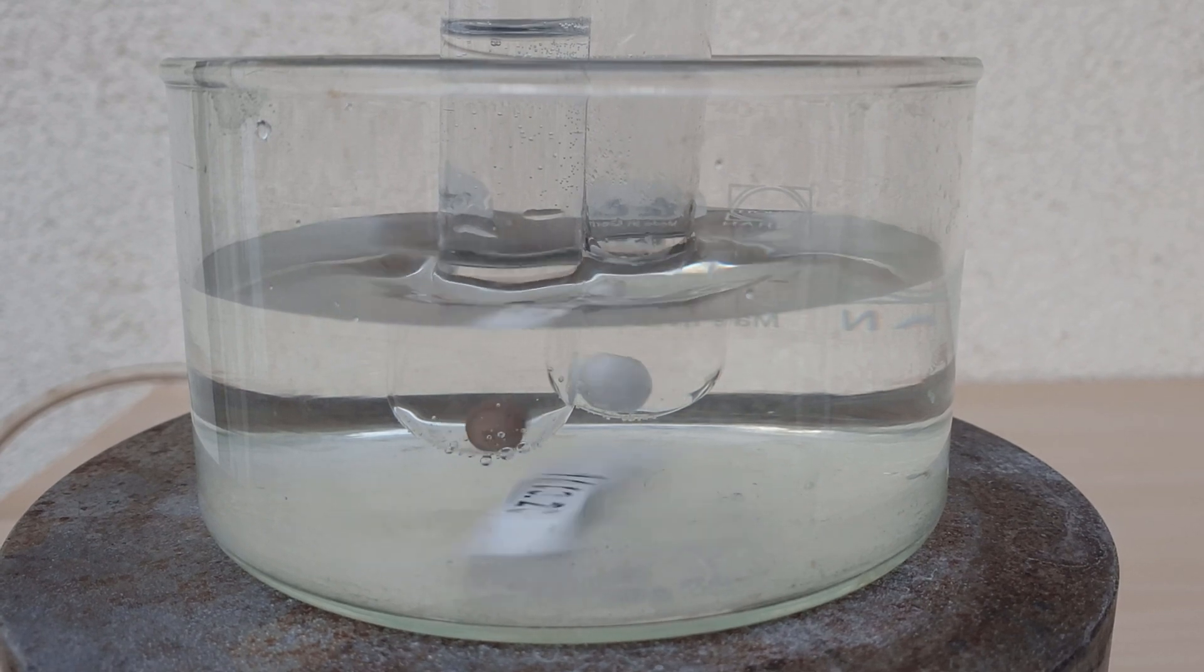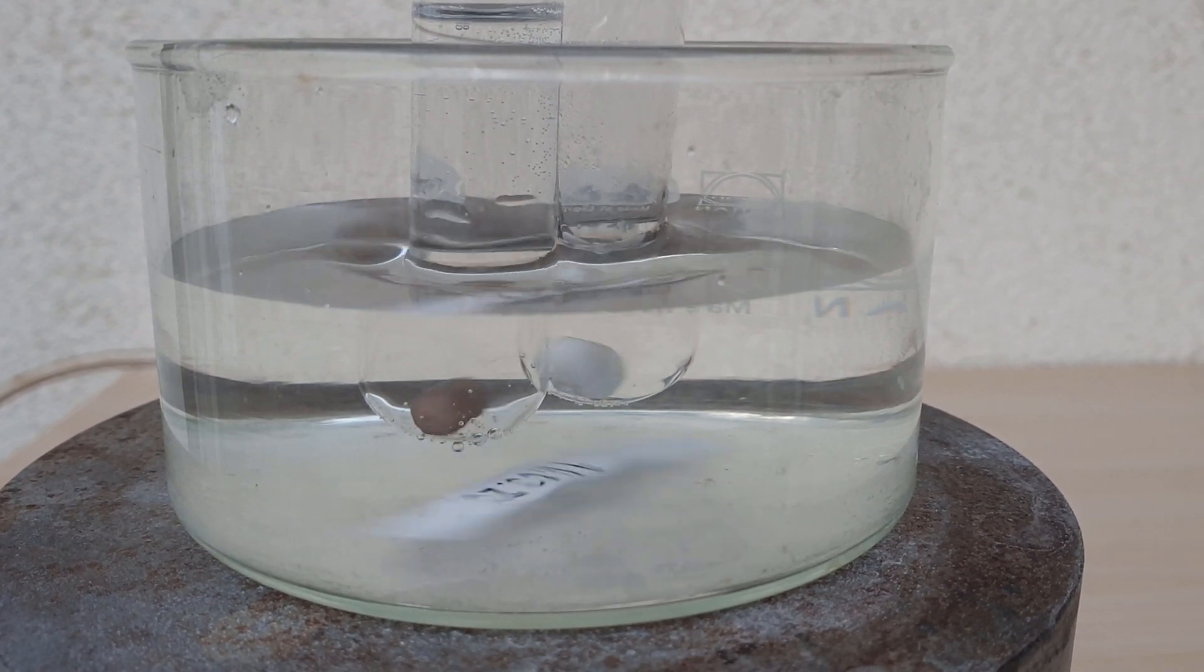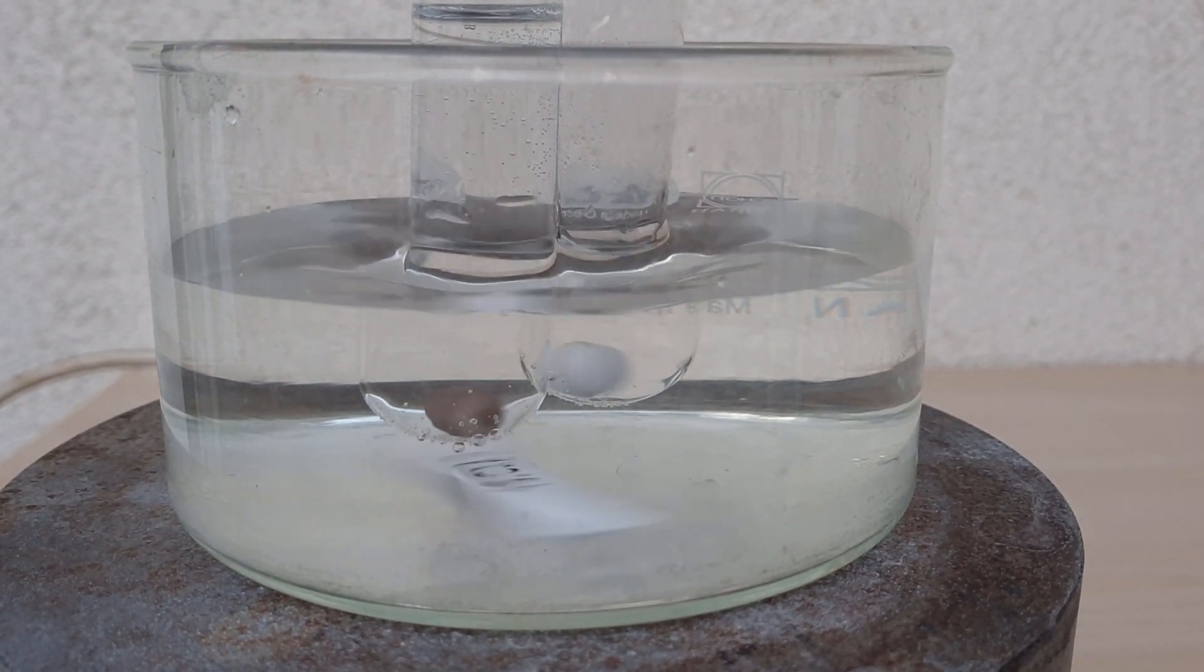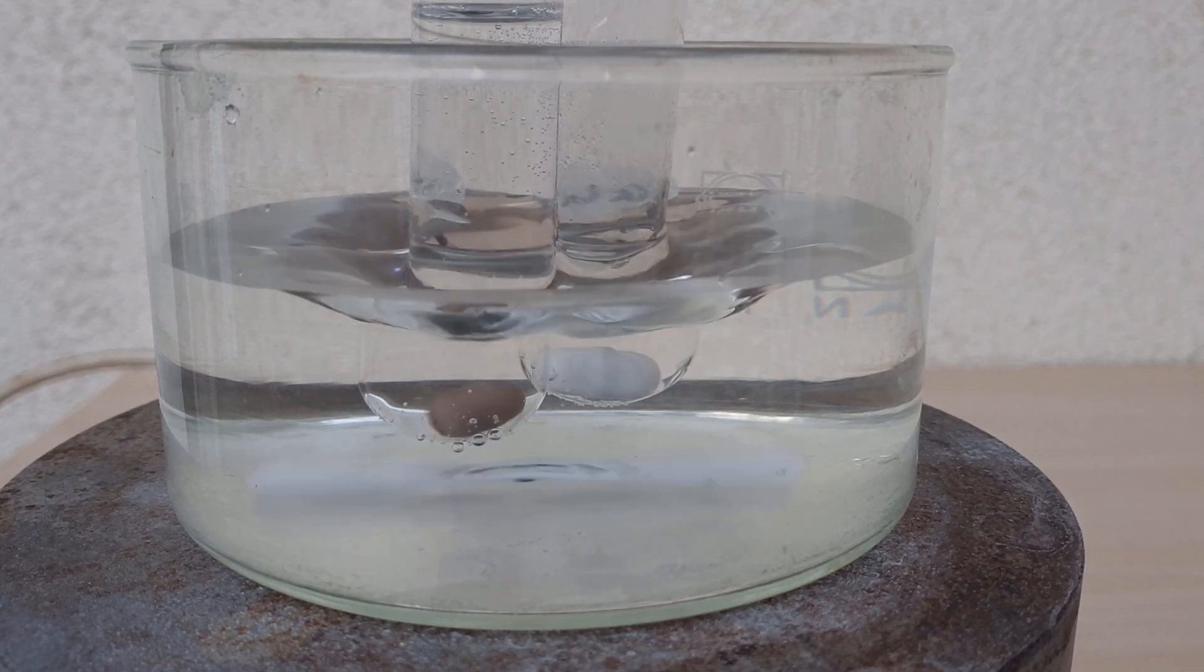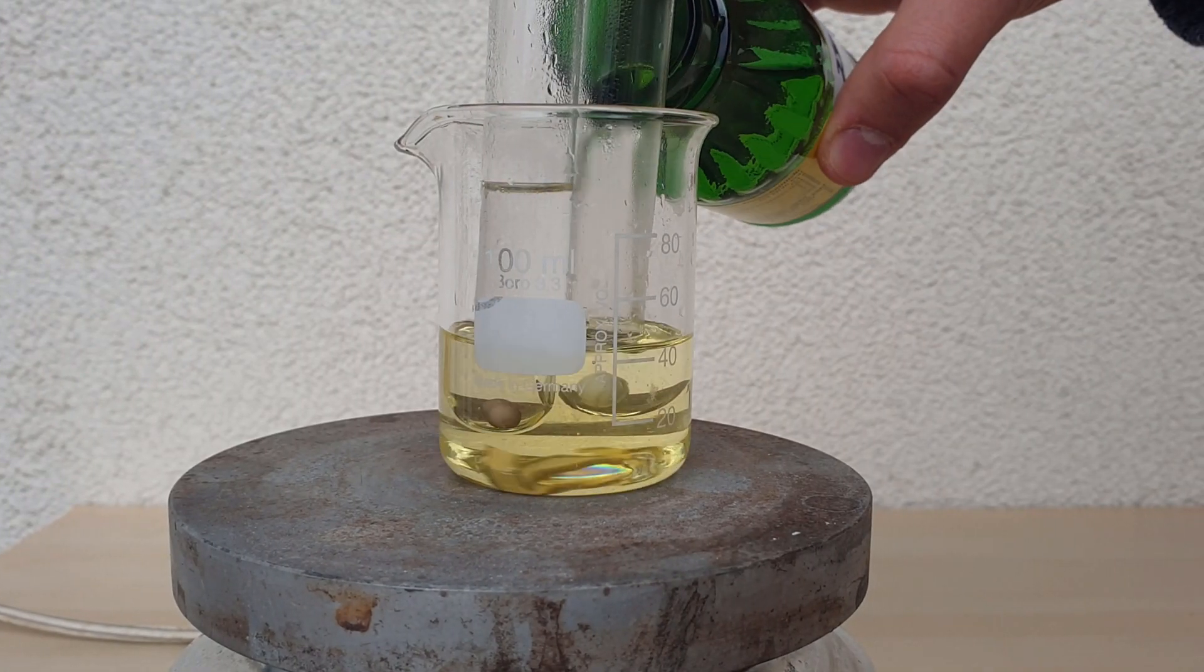First I tried the stupid idea of removing the water with a water bath and midway realized how stupid it was, so I changed to an oil bath instead.